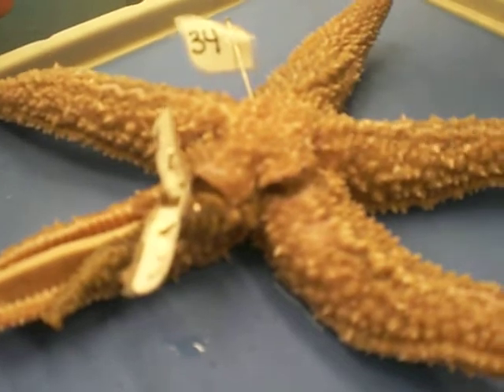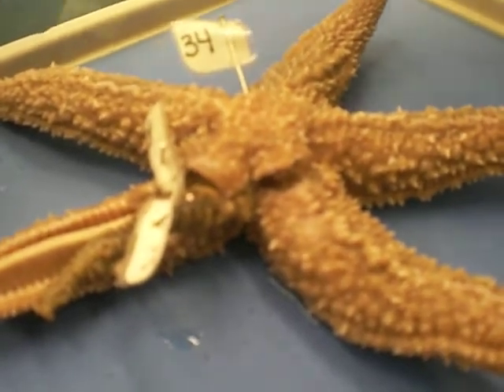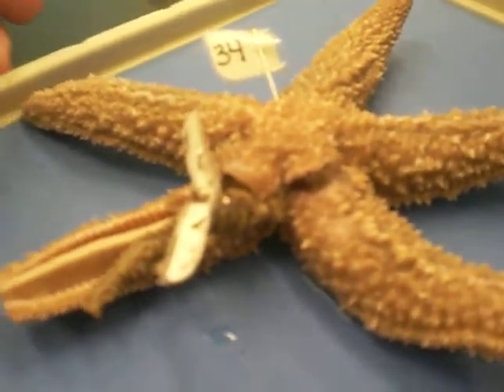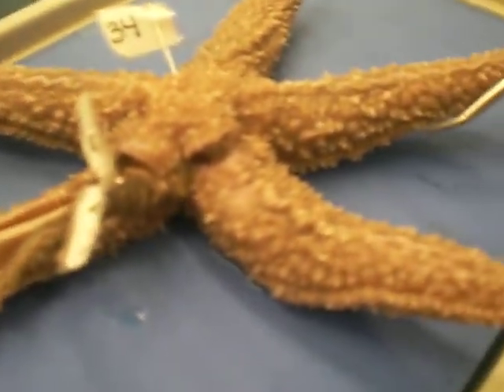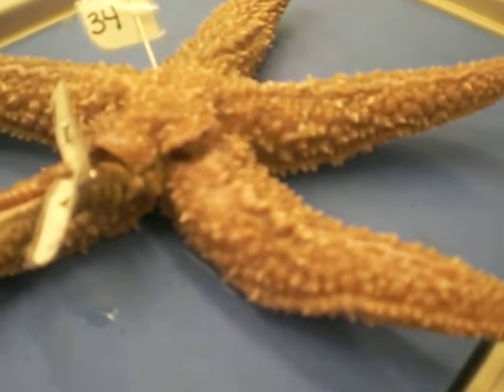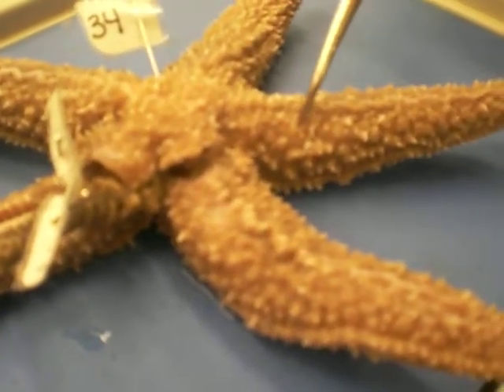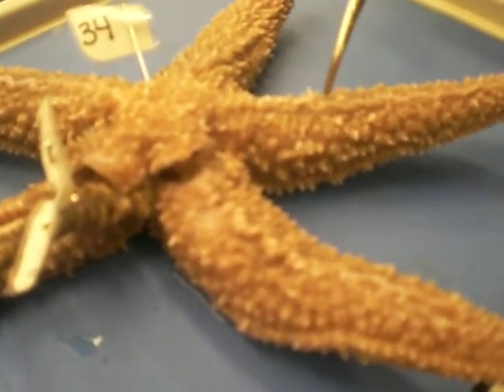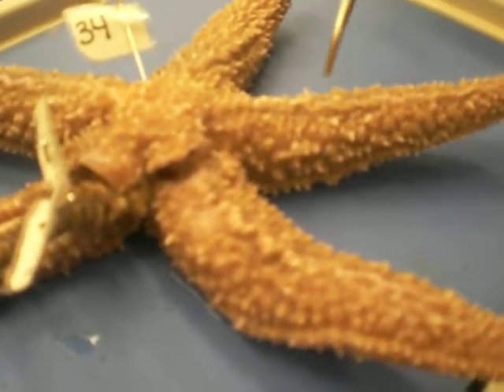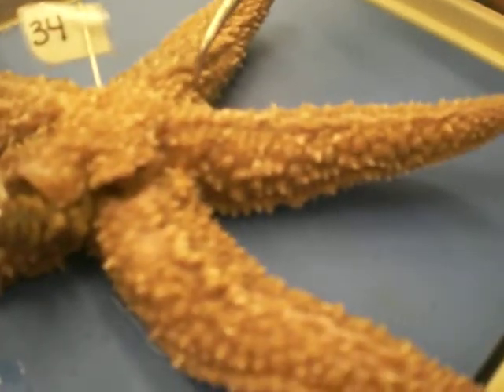Under is oral. These are called rays — five rays. These are the spines. And the gills — the gills would be the pinker ones, and the spines would be the prickly ones.